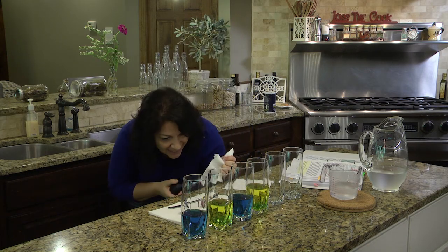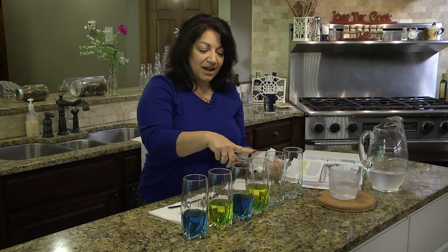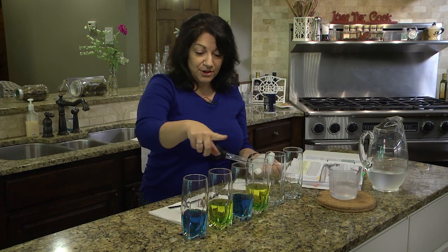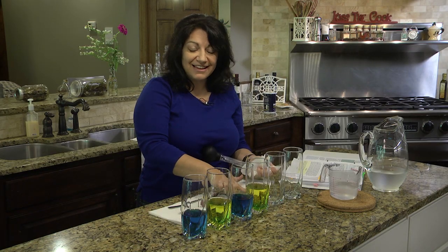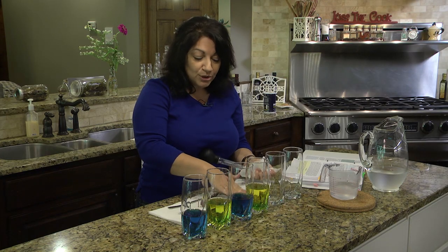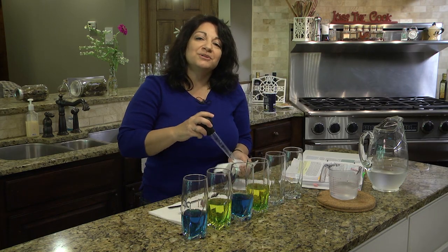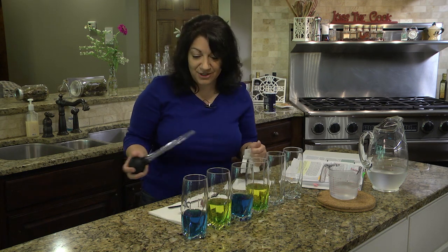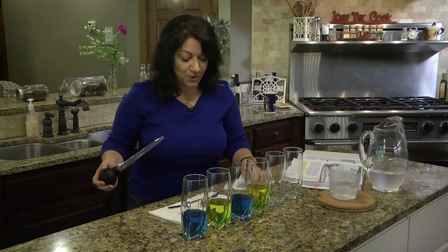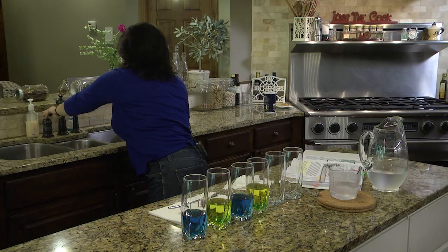Now take a close look at that and compare the blue and yellow of the hot-cold water combo to the blue-yellow of the same temperature water. And you should see that the colder blue water is in a layer below the yellow water. That means that cold water is more dense than warmer water. And the denser material then will, of course, sink lower. All right, I'm going to rinse this out.